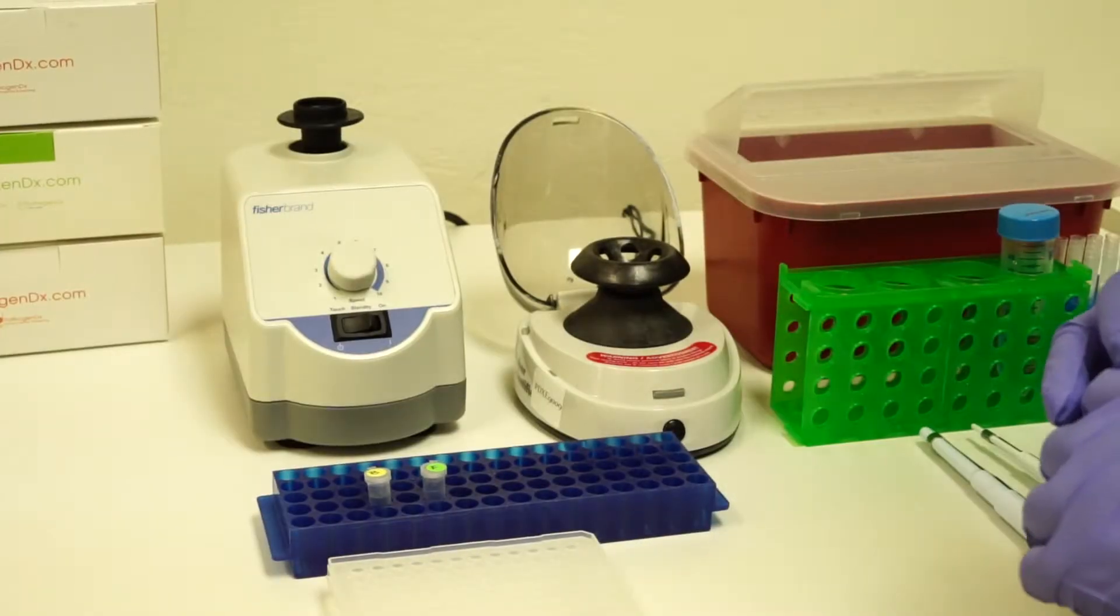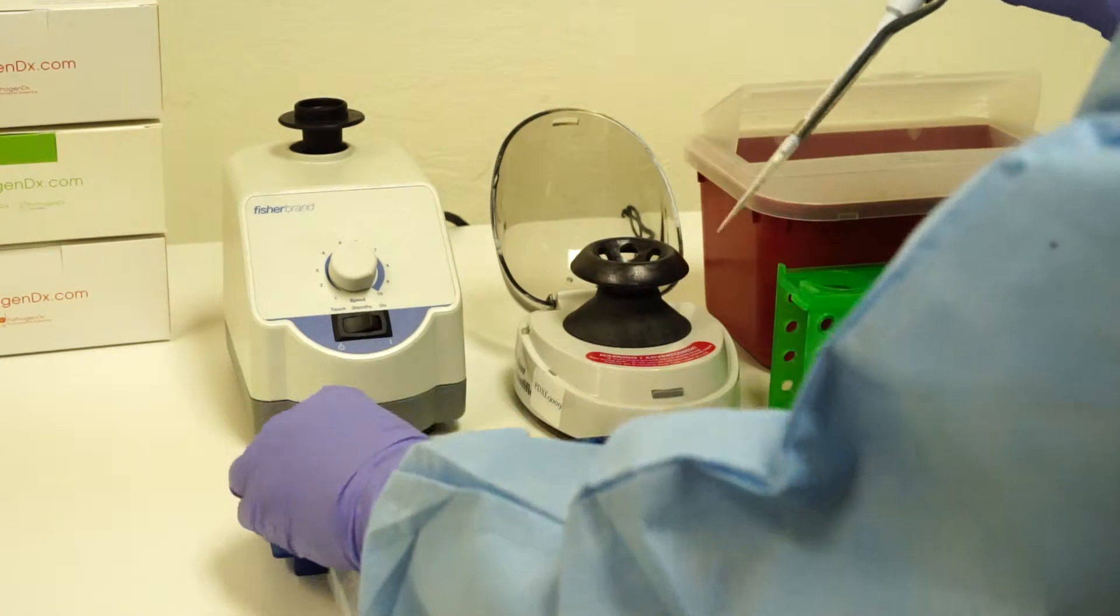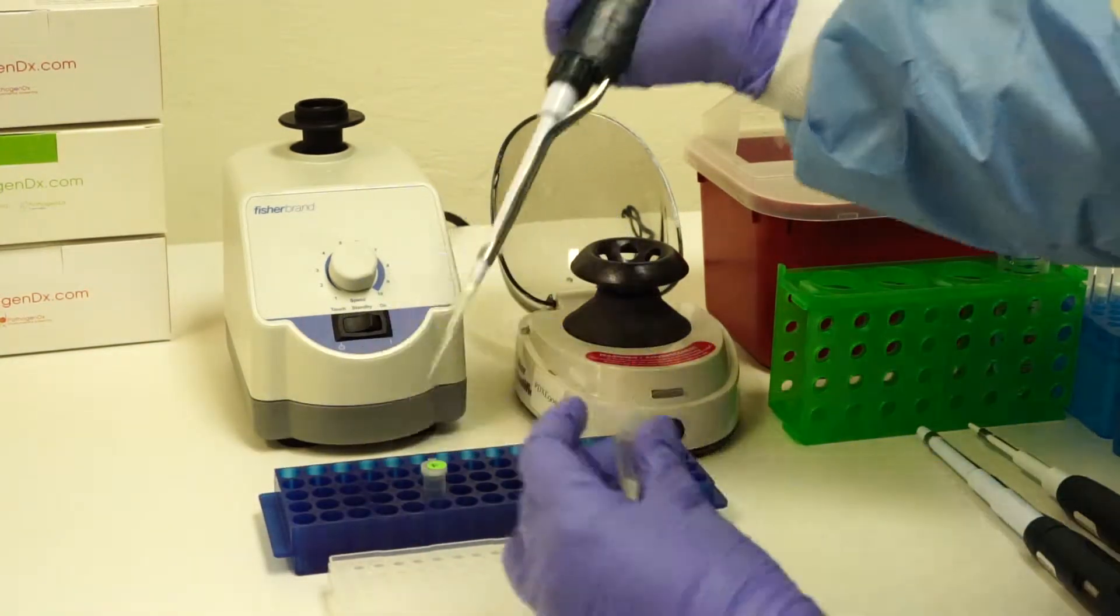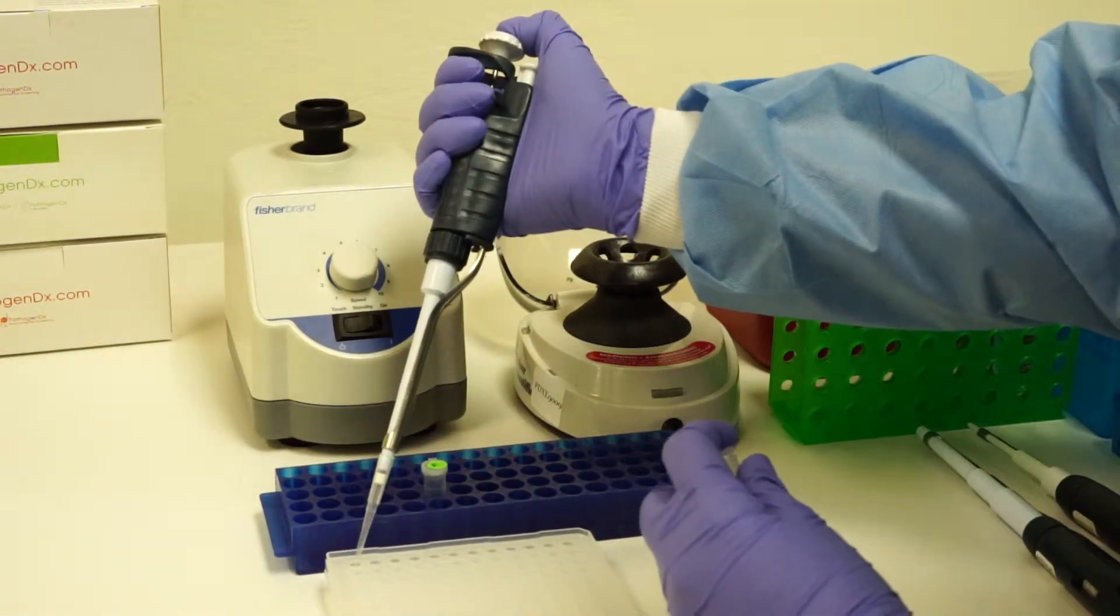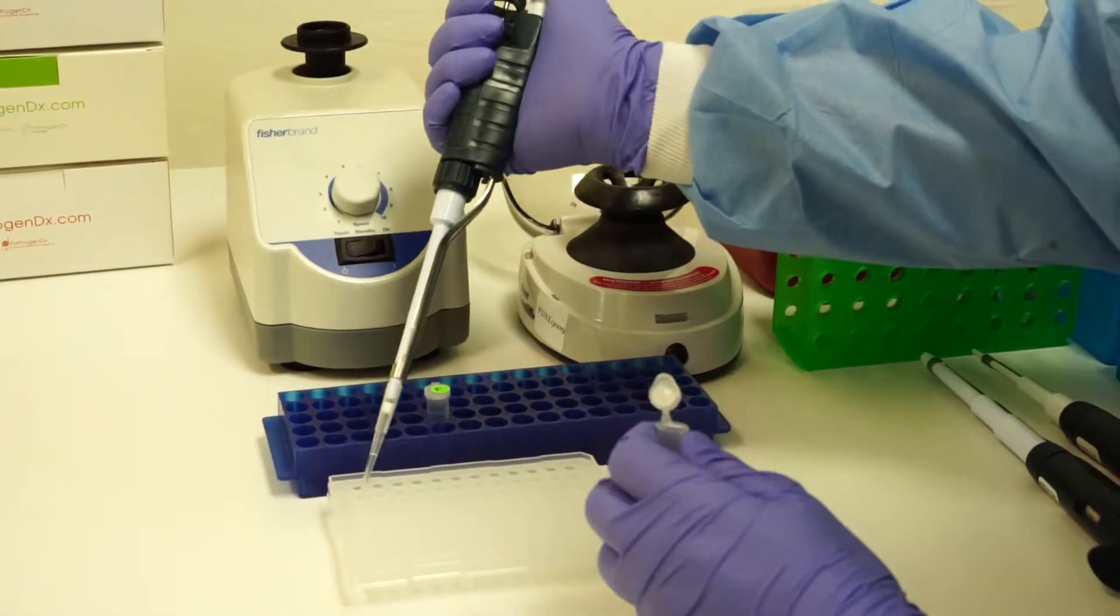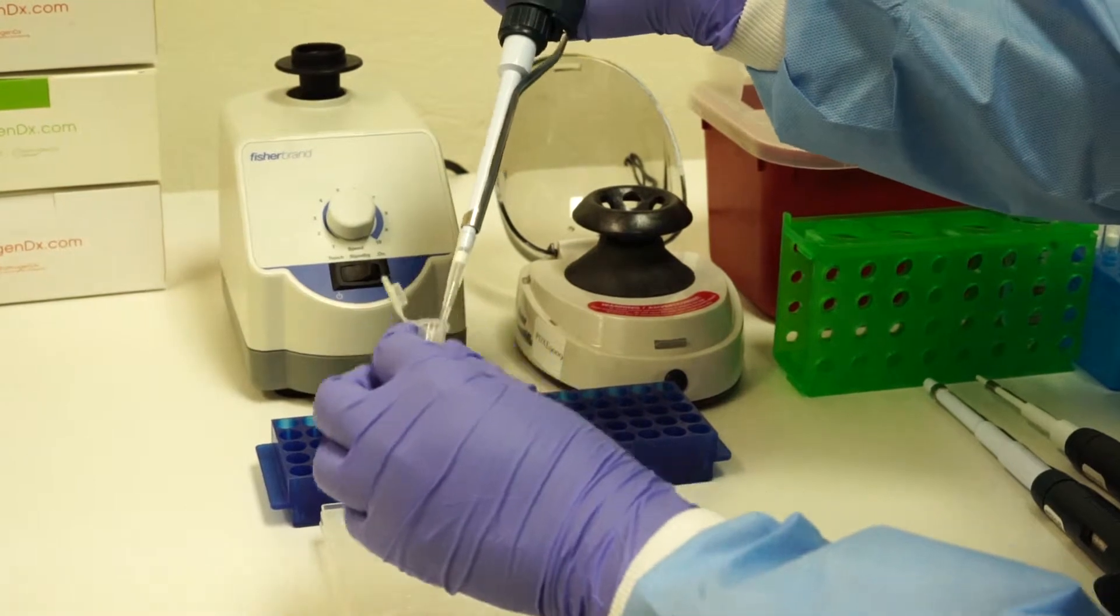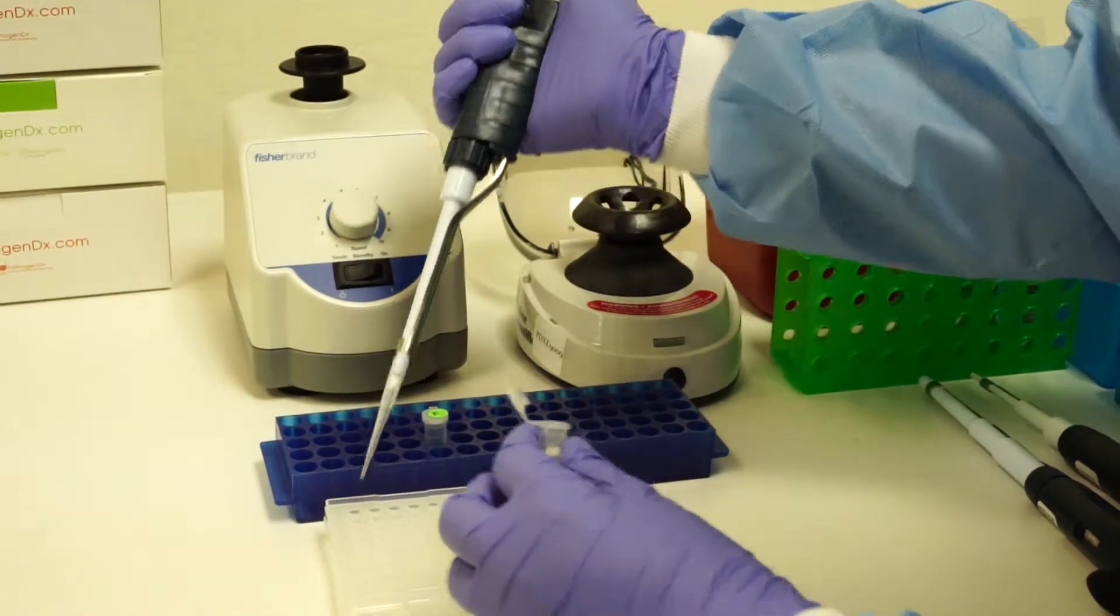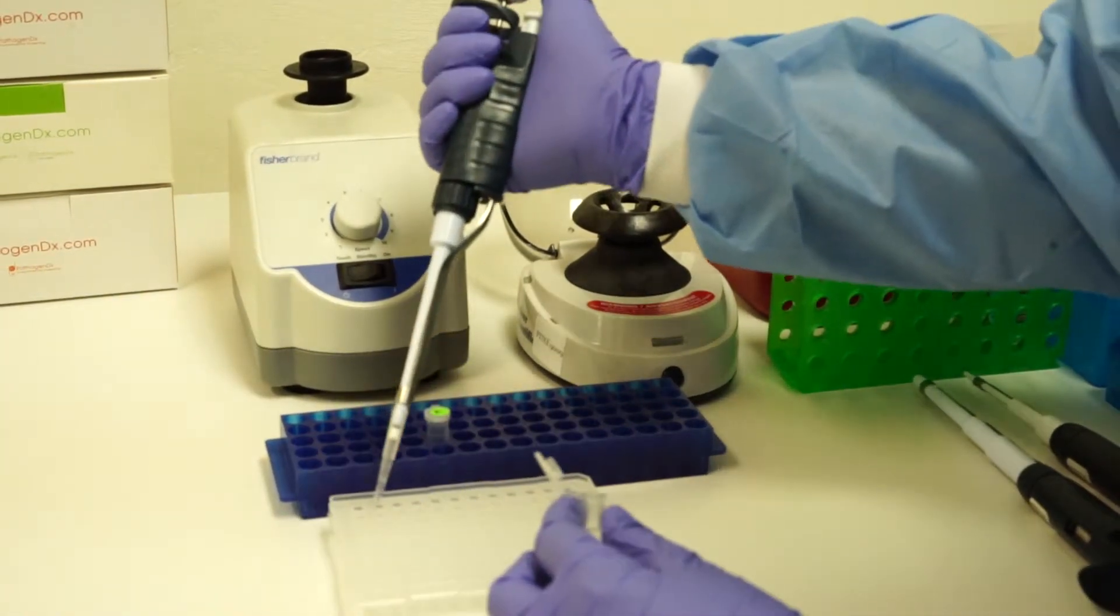Continuing to follow the worksheet, pipette the appropriate master mix into each well, making sure that bacterial PCR master mix is added to the wells designated for bacterial samples and the fungal PCR master mix is added to the wells designated for the fungal samples.